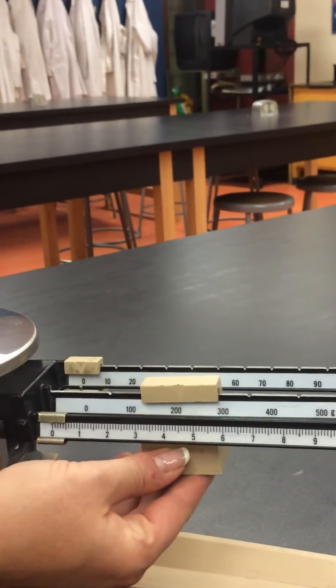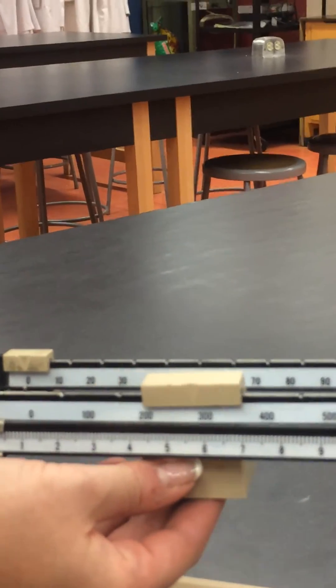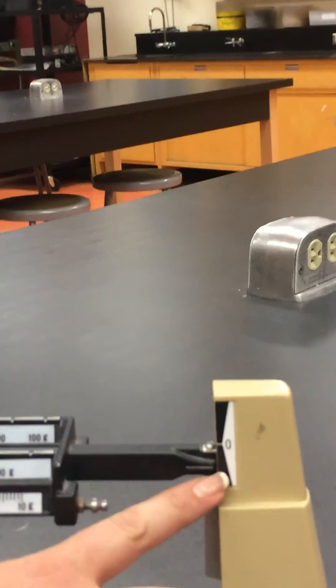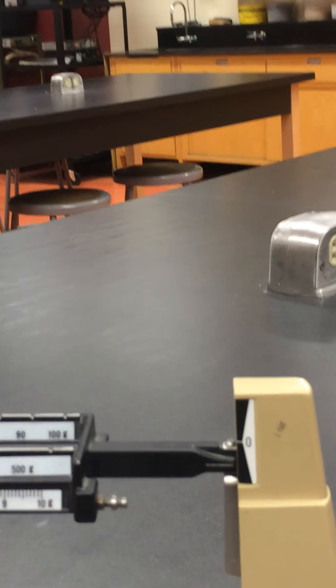100. 200. Oh. When it goes below zero, you know that this is too much. You have to back up one.